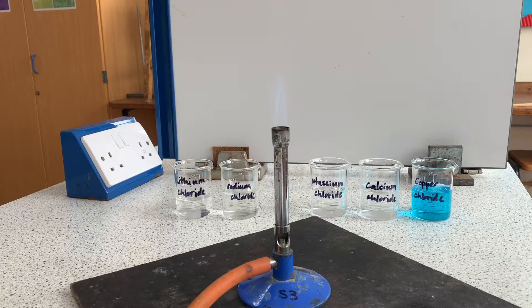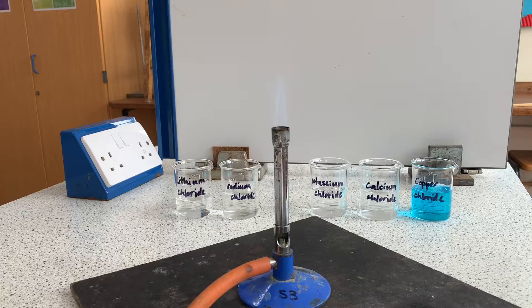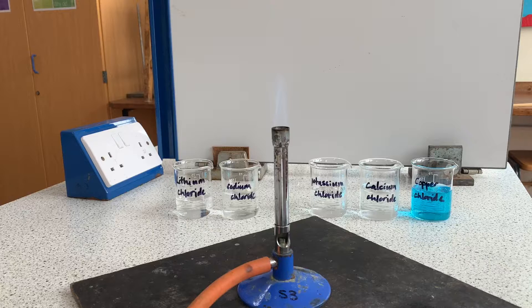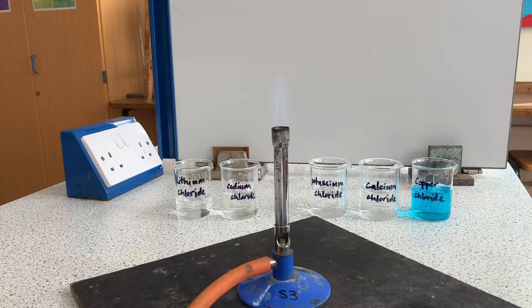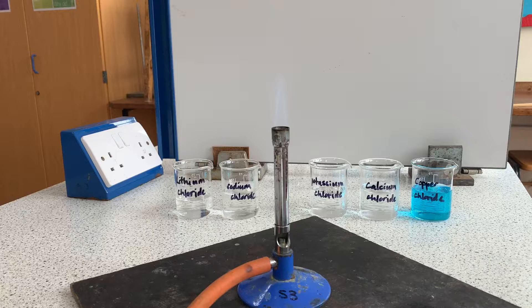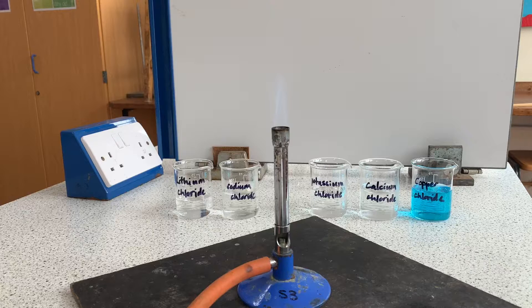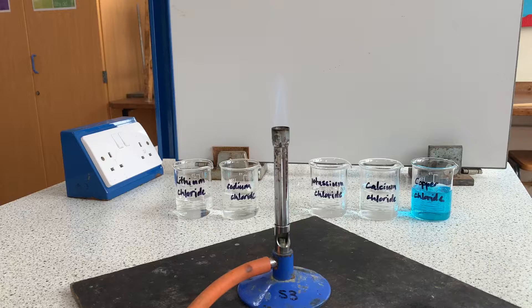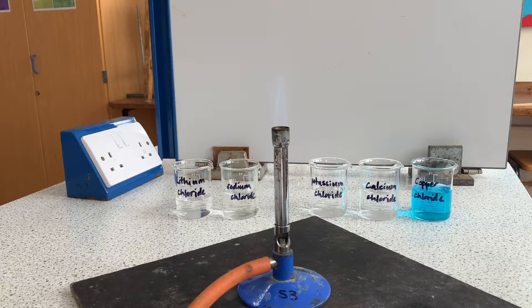Let's start out with a flame test to identify metal ions. The solutions I'll be testing are lithium chloride, sodium chloride, potassium chloride, calcium chloride and copper chloride. They all have the chloride ion in common but the metal is different each time. That allows us to see the influence the metal and only the metal has on the flame color.